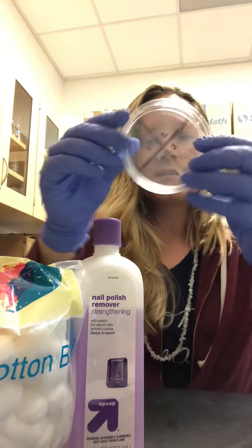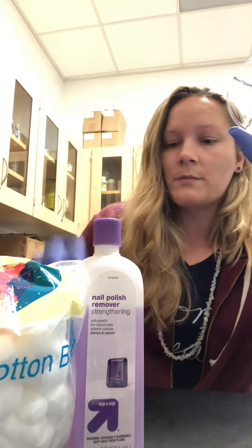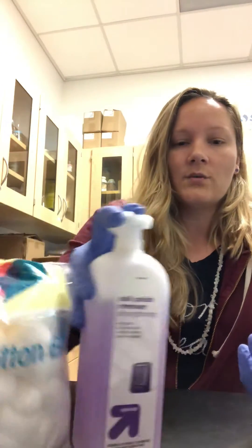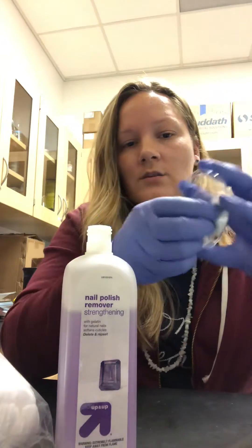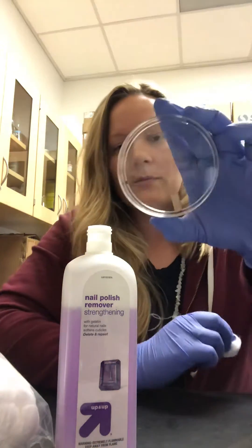Here's an example: when students practice streak isolation in microbiology, they use a sharpie on the petri plate. This was immediately right after class — I collected these, take my acetone, and I can easily remove the sharpie from the plastic dish with fingernail polish remover.